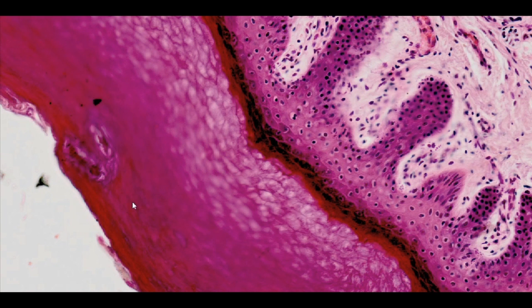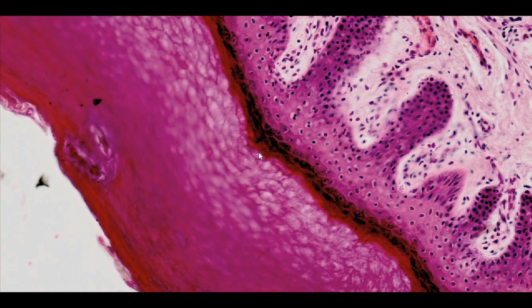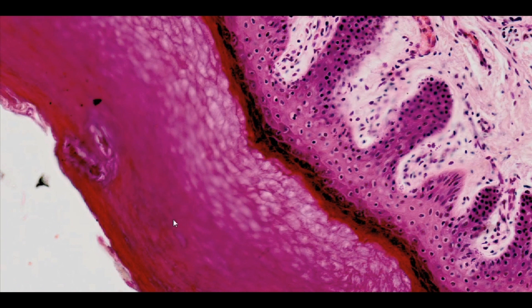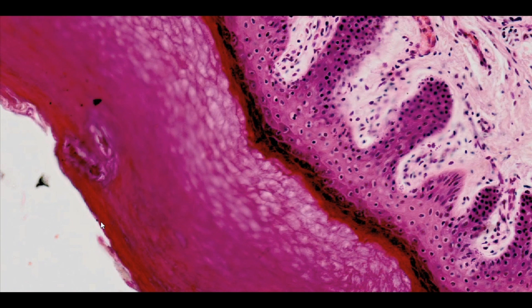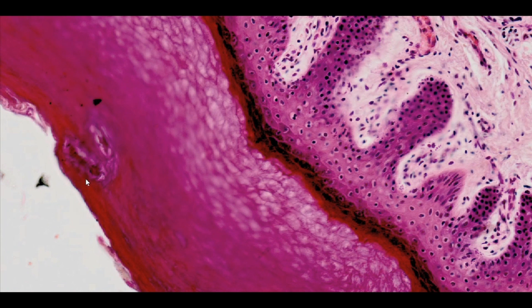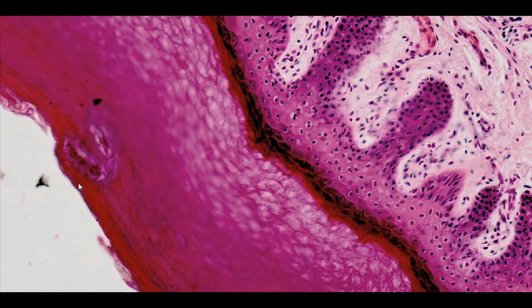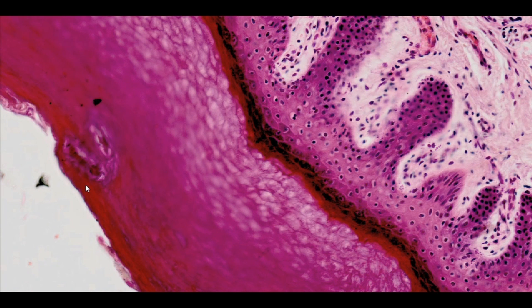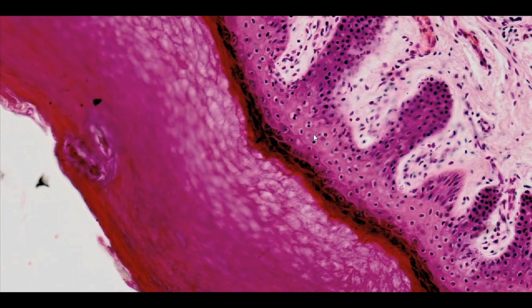The last and at the same time the thickest layer of the epidermis is the stratum corneum, which is made up of dead corneocytes. The lack of nucleus is a morphological determinant of cell death, which is also the case in this region. Due to the change in pH of this layer, its upper part exfoliates systematically. Research conducted at the Department of Histology and Embryology has shown that corneocytes synthesize a protein related to parathyroid hormone (PTH), which by combining with cytokeratin filaments can control their growth and differentiation.